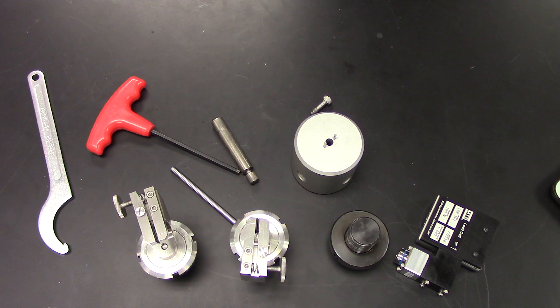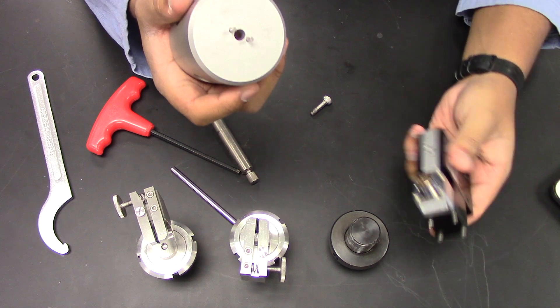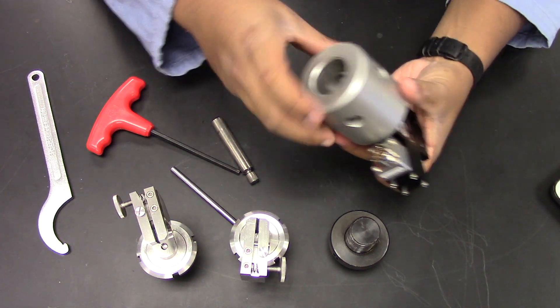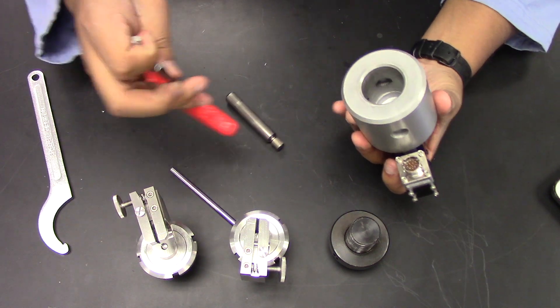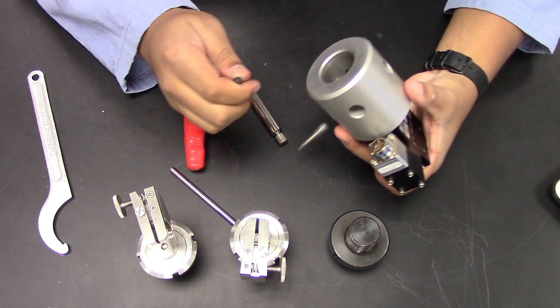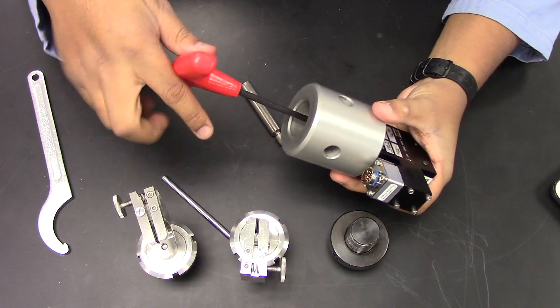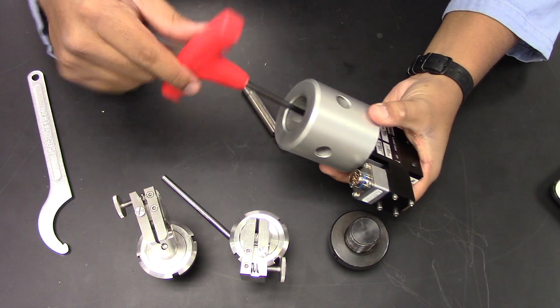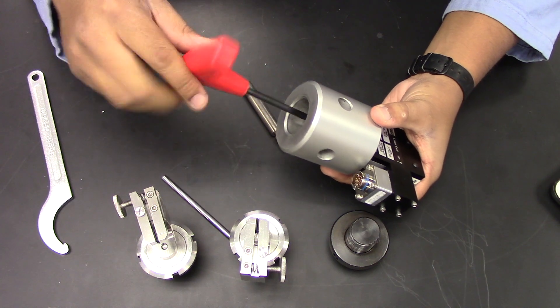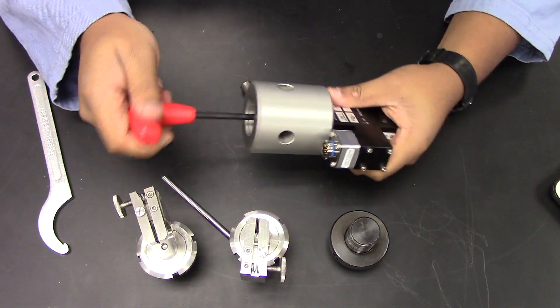When adding low force grips to a load cell, it is important that you place them together on a tabletop to avoid accidentally damaging or mishandling the load cell. To start, we're going to attach this grip connector to the bottom of the load cell. Then we're going to use this screw and this 5mm Allen wrench to secure it together. Make sure it's just nice and tight there.